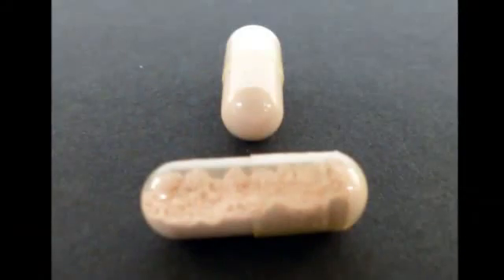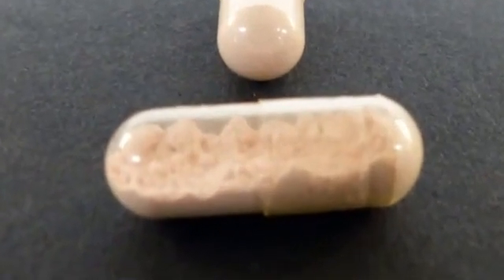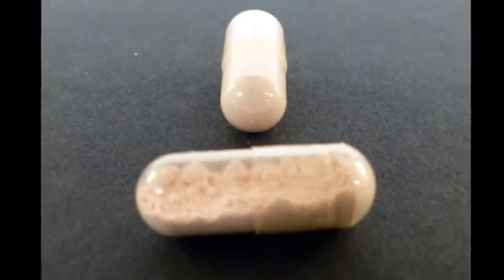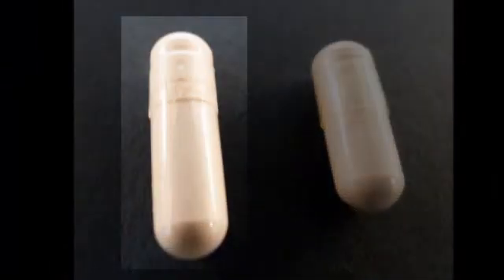However, an accurately weighed capsule may still be underfilled or overfilled. If the correct weight is reached, but the powder is very loose inside, the capsule is underfilled. The powder must be emptied out and punched into a smaller capsule. If the correct weight is reached but the capsule cannot be locked, it is overfilled. The powder must be emptied out and punched into a larger capsule.